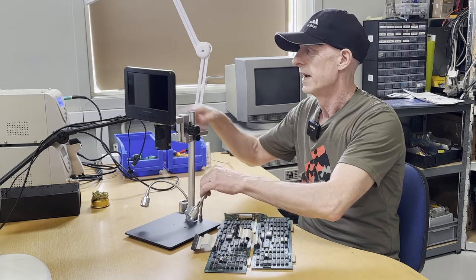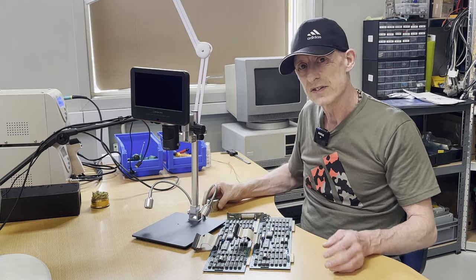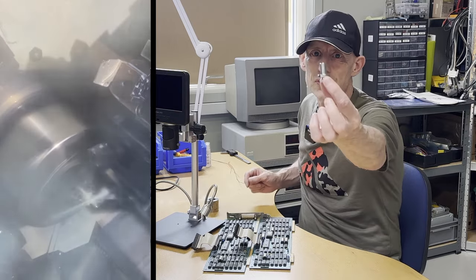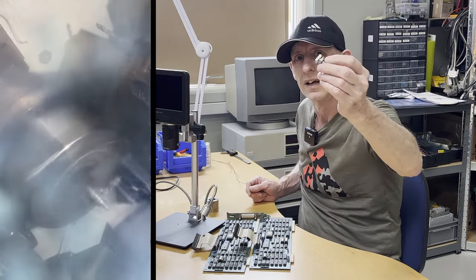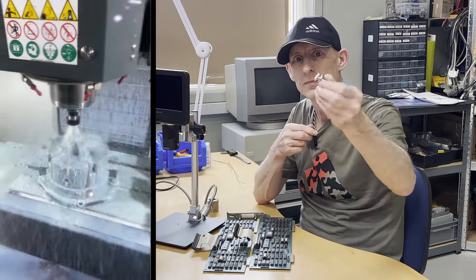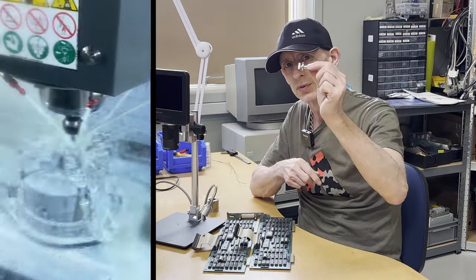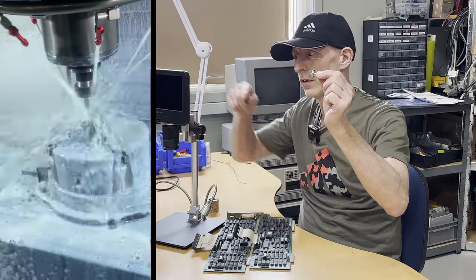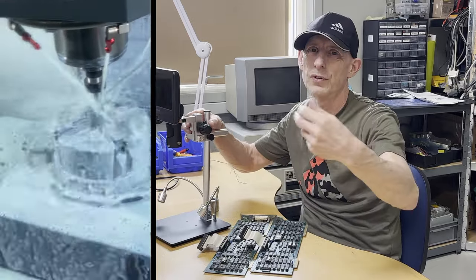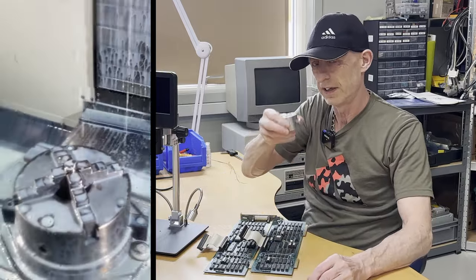So it came like this and I mounted it on this via this. I've changed everything and I know you can't see it right now, but I produced this tiny piece. I went into our CNC machines and I cut this out in some metal. And this is all that I'm going to use going forward - I'm only going to use the camera and one piece, this piece. So the rest of all of this, which was very heavy, that's all gone.